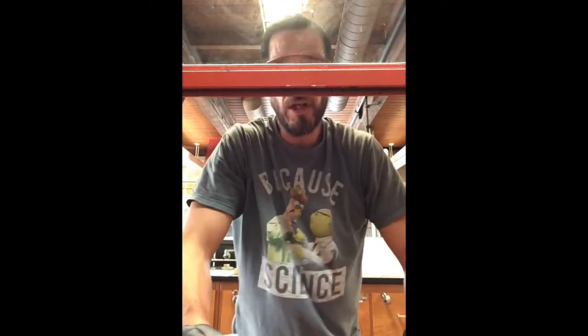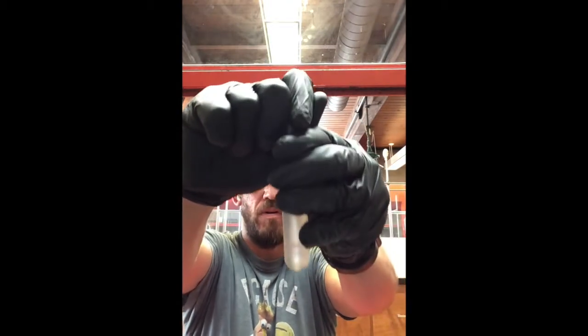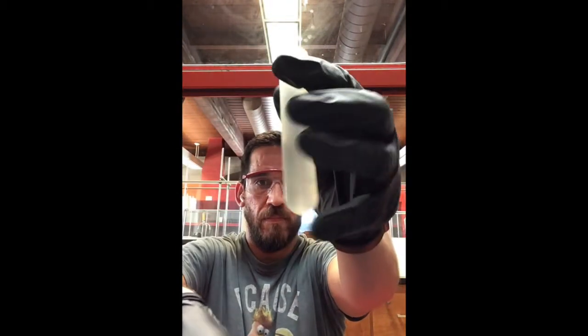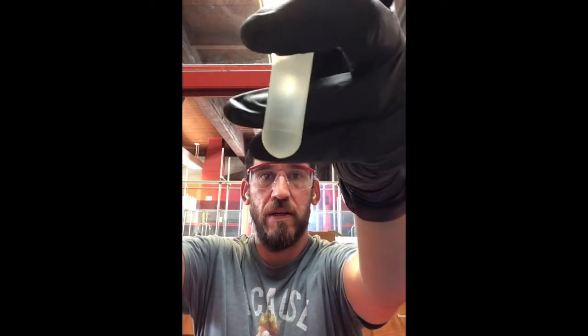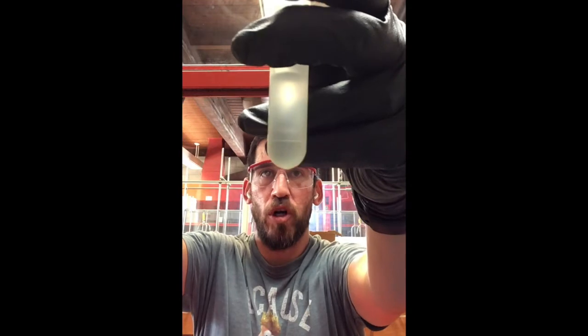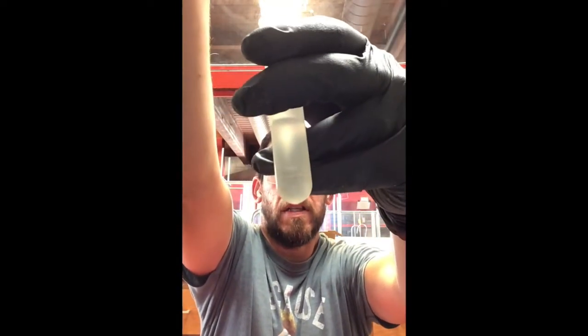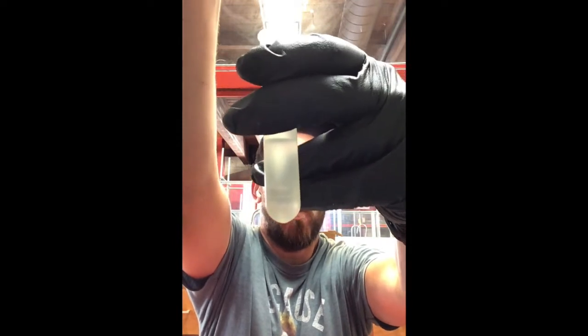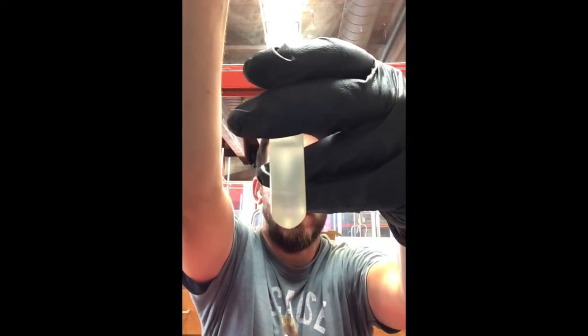Another thing you can do is you can actually look, if it's possible. Let's try it. So if you can observe where that drop of methylene chloride goes, then you can be more confident as to which one is which in terms of the layers.